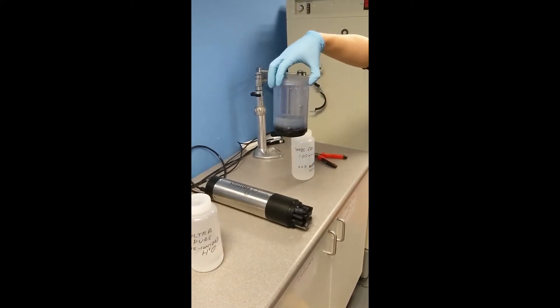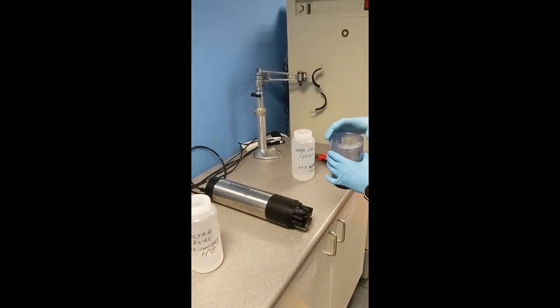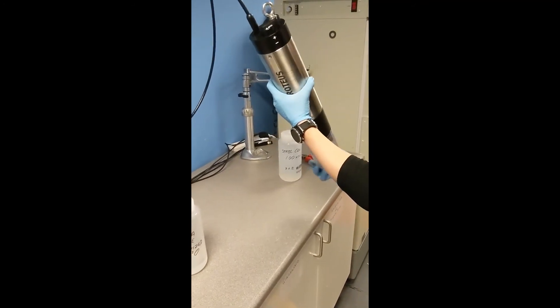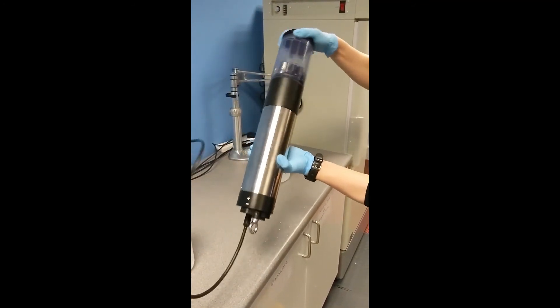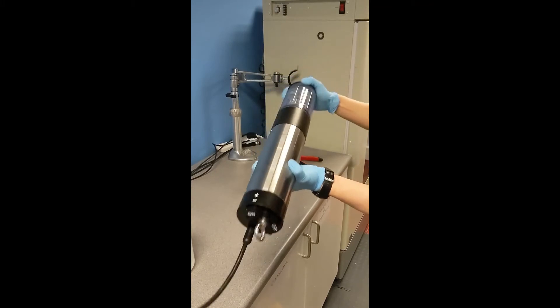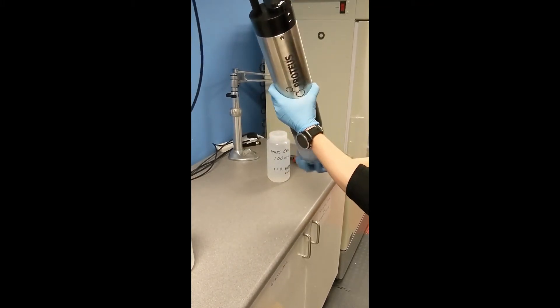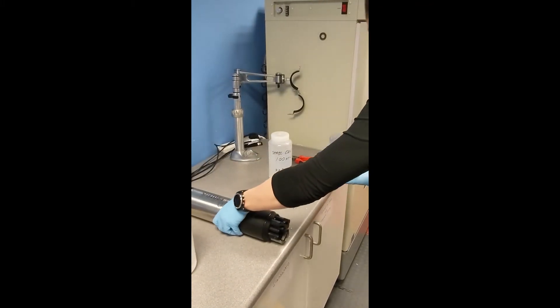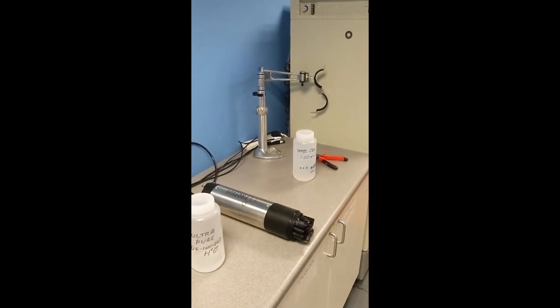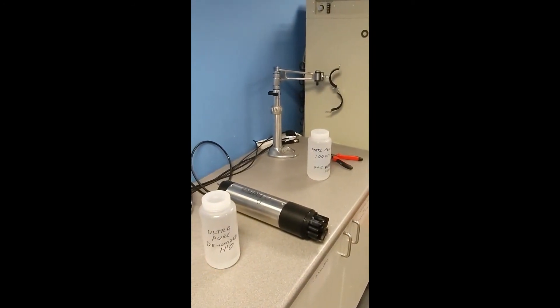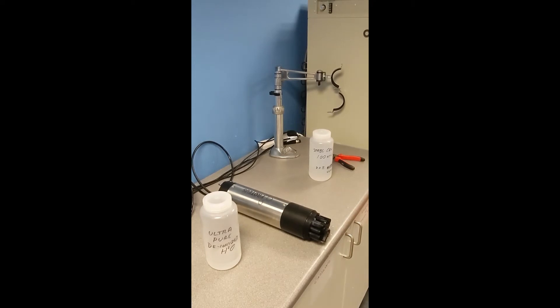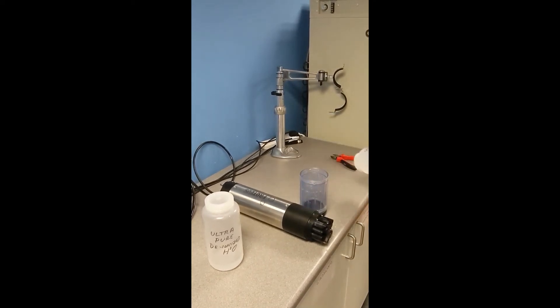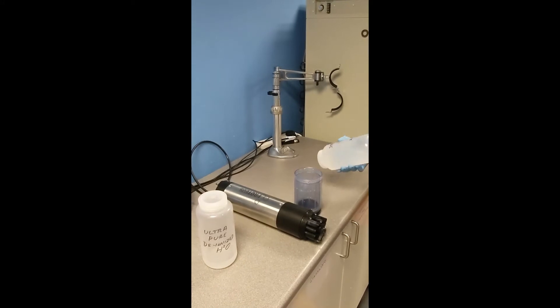So a small amount of turbidity fluid in there, rinse it around the sensors. Invert it again, just gently.